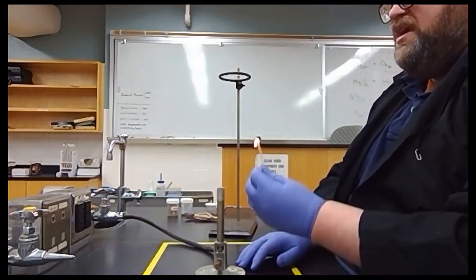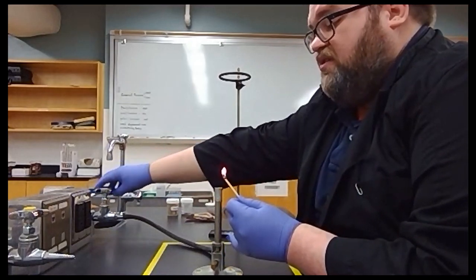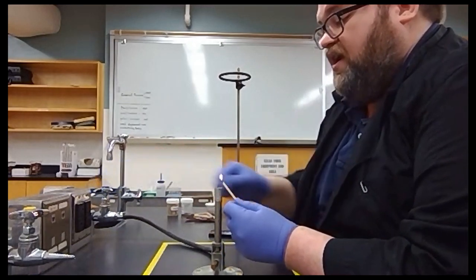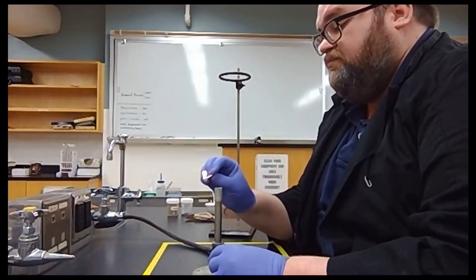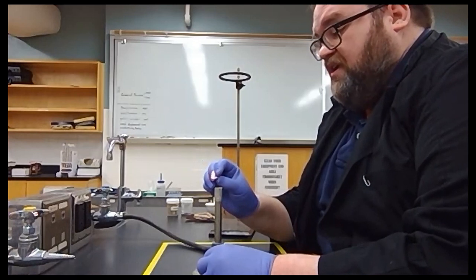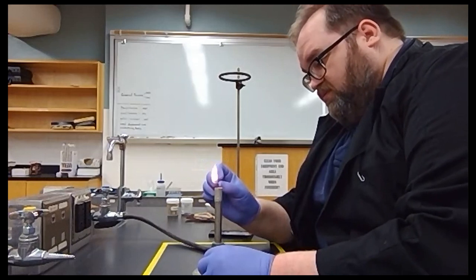We strike our match and hold it just off to the side and turn on the gas with gusto. Don't be afraid of the gas. As long as you're standing back you're going to be fine. Then we're going to begin doing adjustments until our flame is a stable two blue cones.